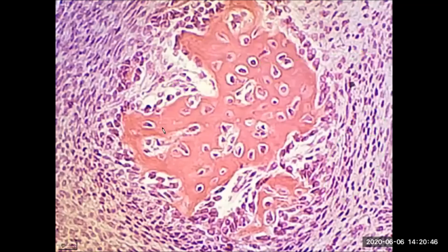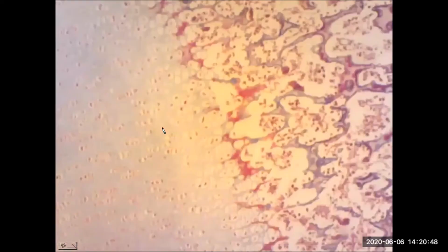So now our last sample. Intramembranous ossification we just viewed, and now going into endochondral ossification, the cartilage type of development. You notice on this sample, we have a wider zoomed out view. And on one side of the view, we're seeing cartilage.